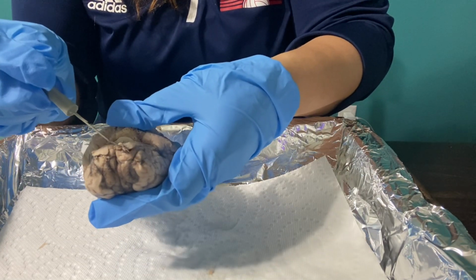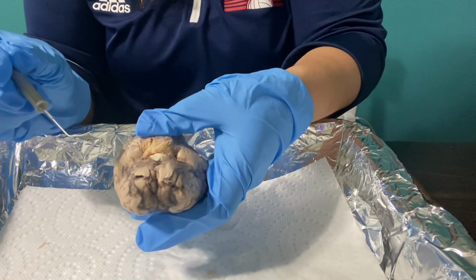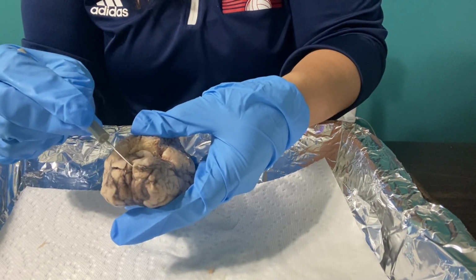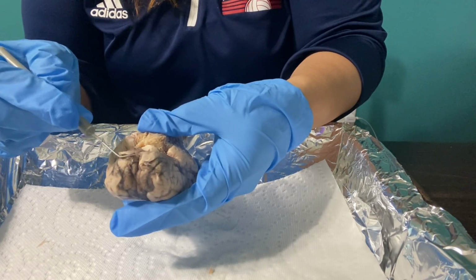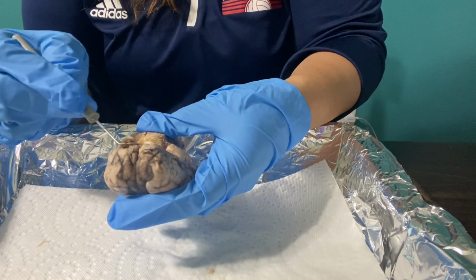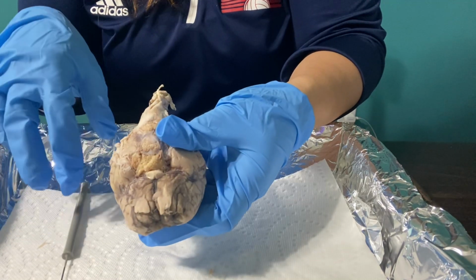And then within this section, I wanted to bring attention to these little flaps that are at the very front of the brain. I don't know if you can see that, I'm lifting them up. These are the olfactory bulbs, which is what the sheep would use to communicate, basically receiving information about smells from the nose, and then it sends this to the brain. So it's very similar, identical to ours. These again are the olfactory bulbs.